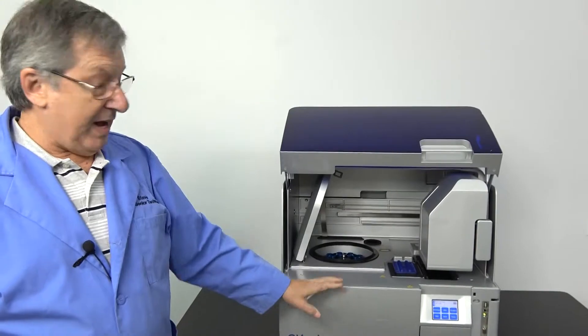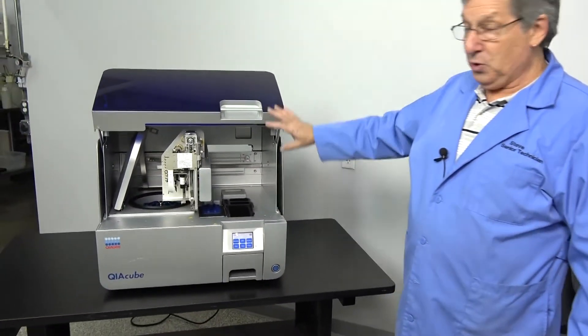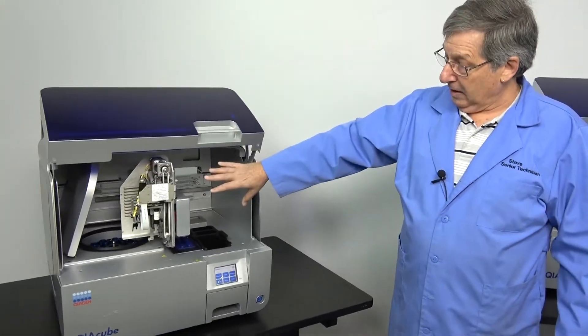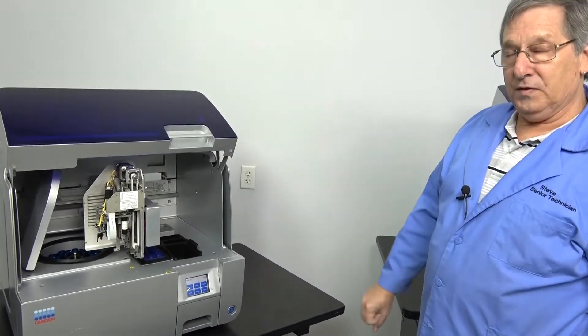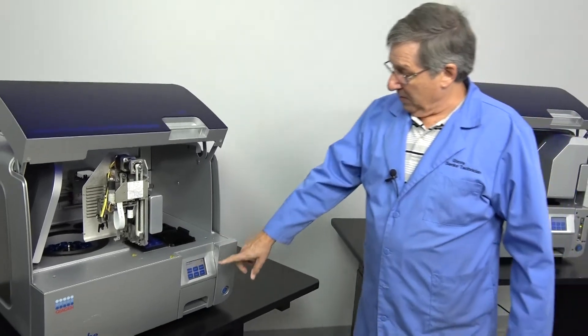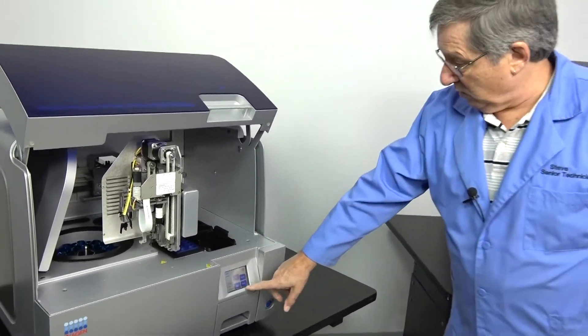We've taken the advantage to disable the door interlock and to take the head off so you can see what goes on in one of these units and how involved they are.